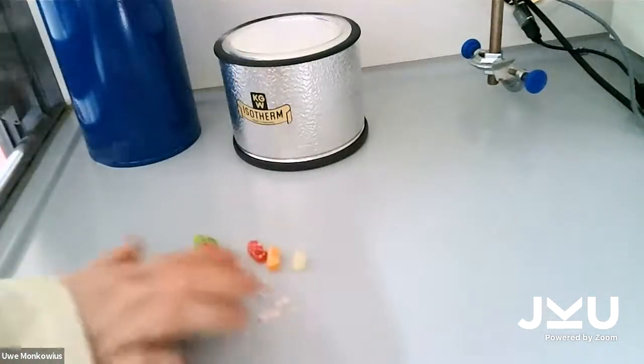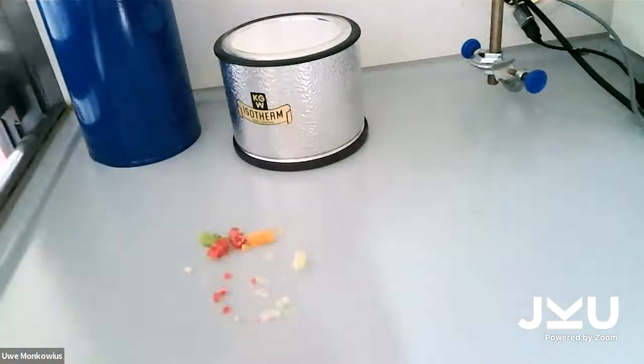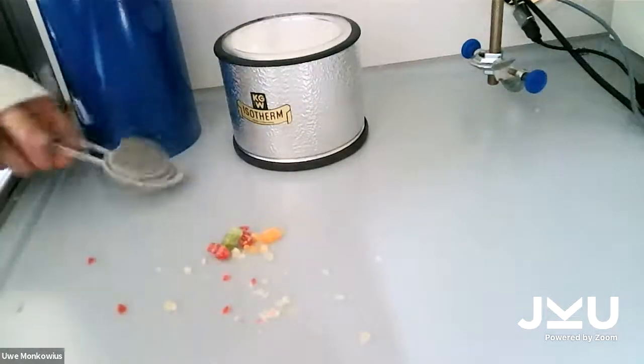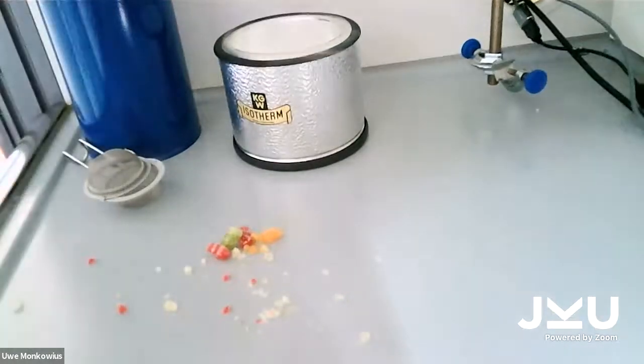You can see that one of them is already broken, the white one. And when I take one, it's really cold. I take one and just drop it a bit. You will see it immediately shattering. And to be more fun for me, I will now use a hammer.